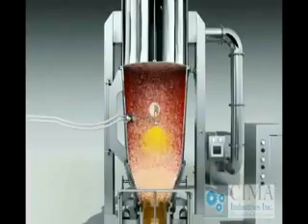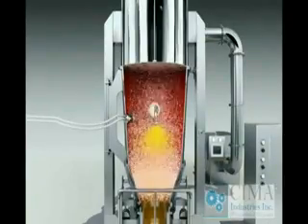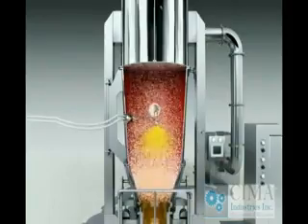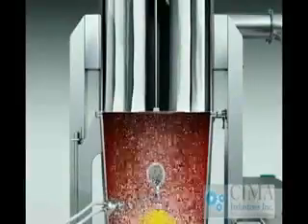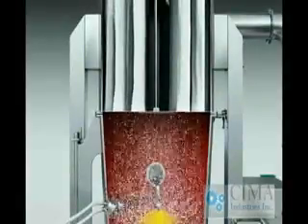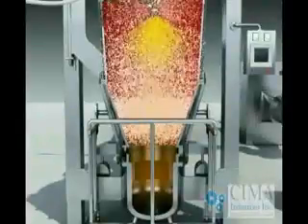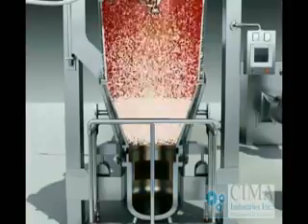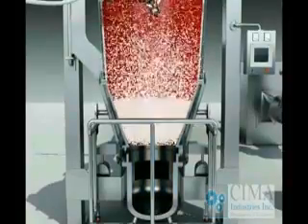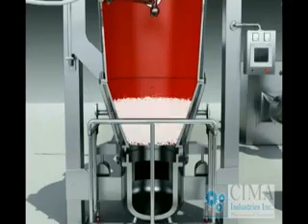The powder material becomes bigger and is forced back to the fluid bed when the air speed lowers down in the expansion chamber. The very fine powder goes up into the powder collecting chamber and is captured by the filter cloth bags. Pneumatic shaking arrangements shake the filter cloth bags so the powder drops down to the fluid bed. The process circulates during the granulation process to make the desired granules, normally around 20 to 80 mesh.